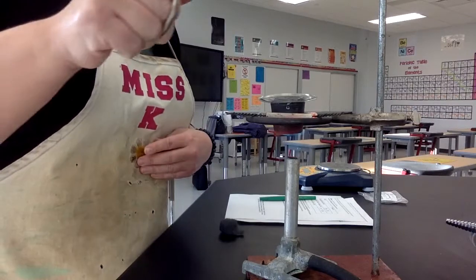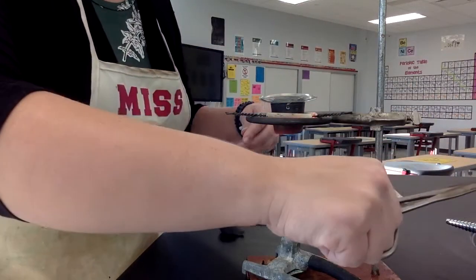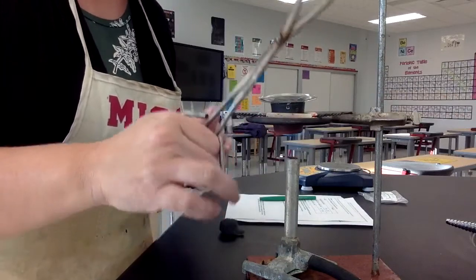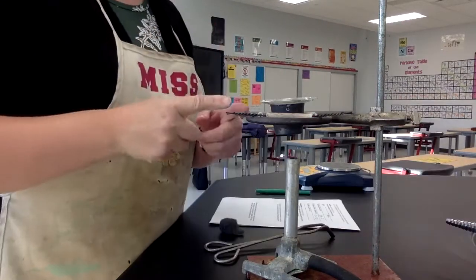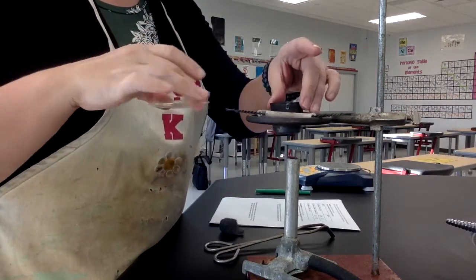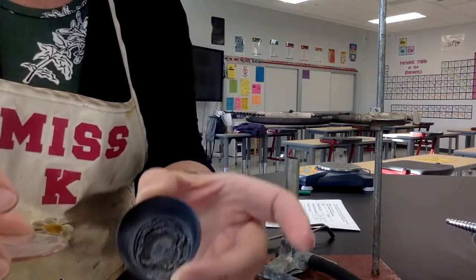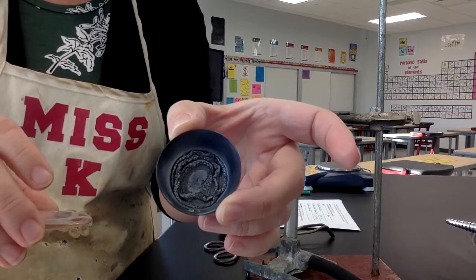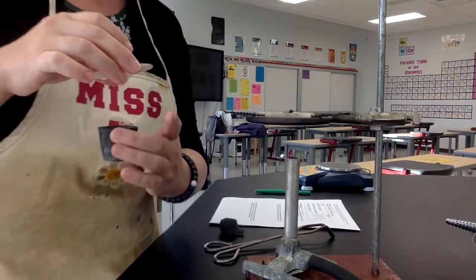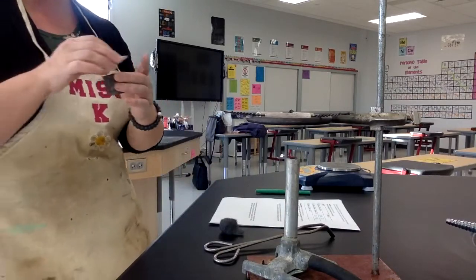Okay, so now I'm going to turn the gas off, and I'm going to let the system cool. So I'm going to do a little time lapse. So pause here. Okay, so this is cool to the touch now. So now I'm ready to get my last piece of data. I'm going to first show you what it looks like in there. So remember what it looked like when it started, and now we've got this ashy product. So I take my watch glass, my crucible, and my product.